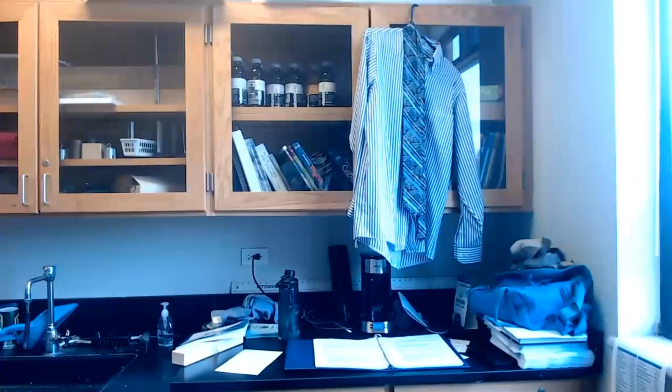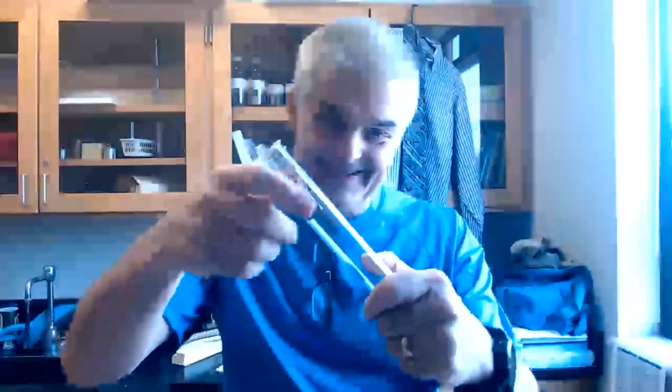Isn't chemistry awesome? Today we're going to do two fireball experiments. Experiment number one involves something crazy cold. It's like fire and ice. We're going to take a test tube like this. With the clamp, we're going to stick it into a vat filled with crazy cold, negative 200 degree Celsius liquid nitrogen. The test tube's going to get crazy cold.